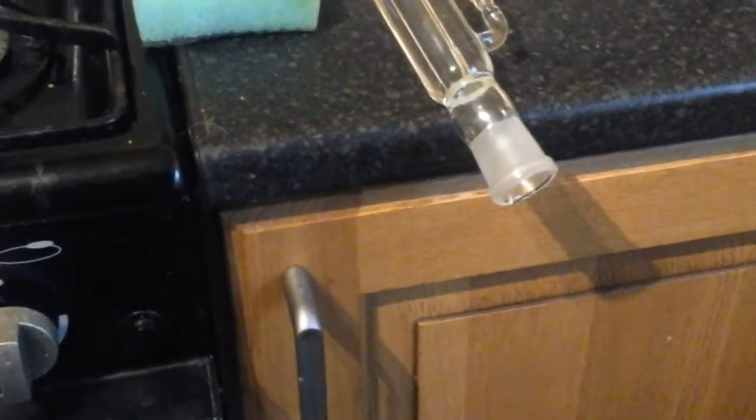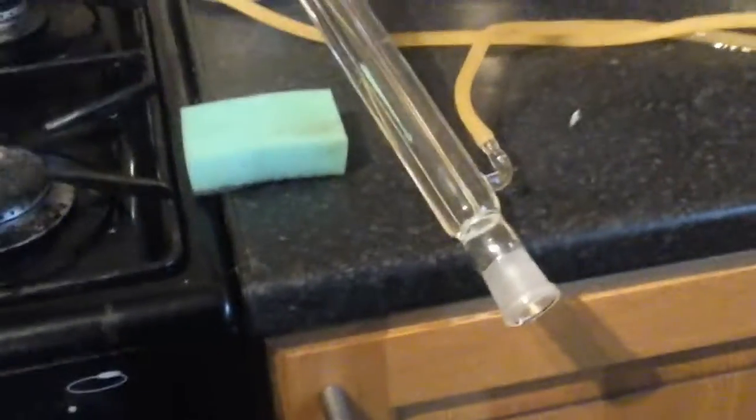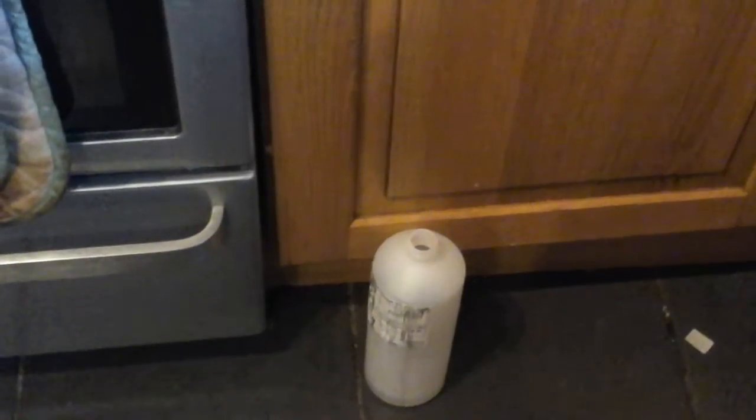And at the bottom this steady trickle of dichloro — to make sure that it's still dichloro. Oh yeah, it chills the skin quite a bit so definitely good, nice and pure-ish. It drips down into the collection pot.